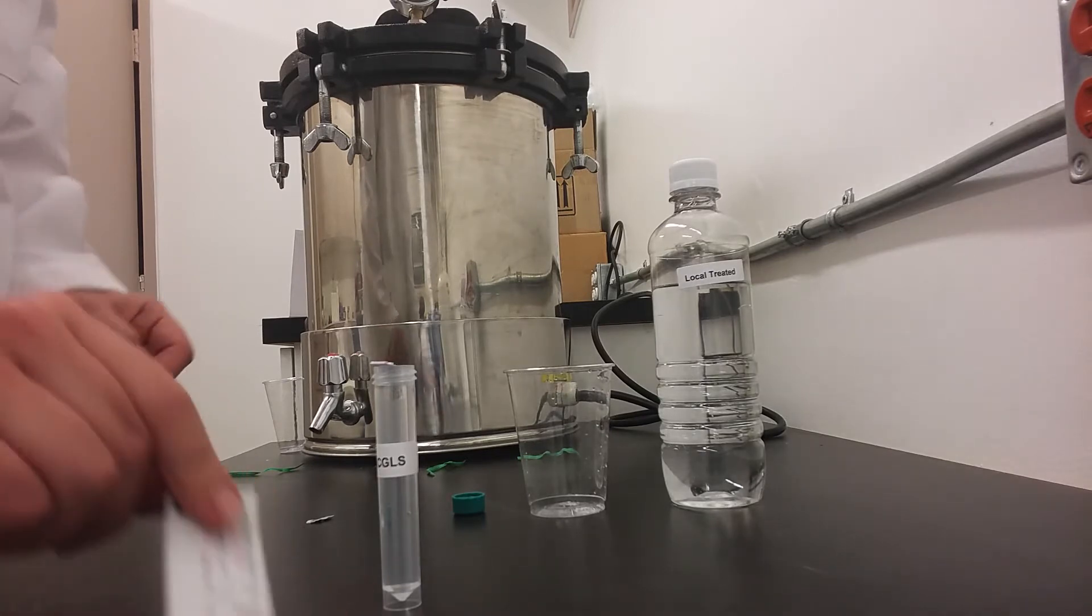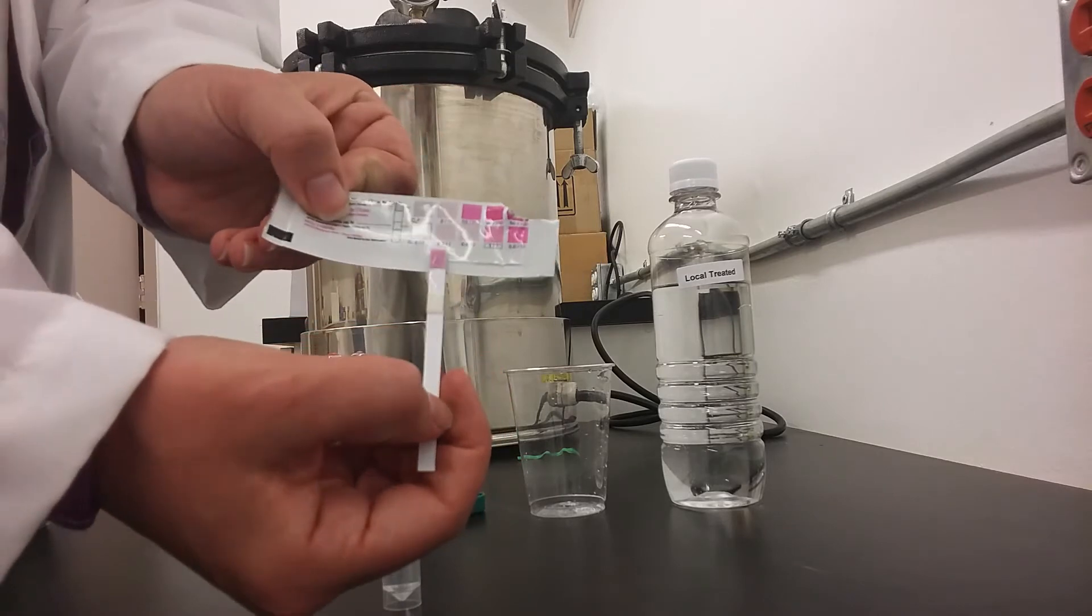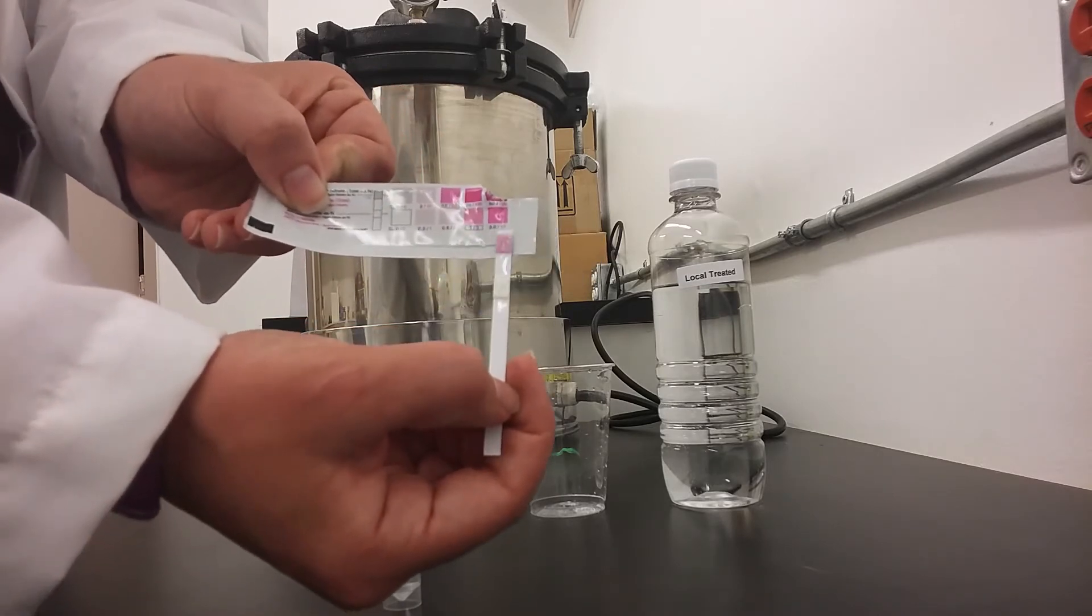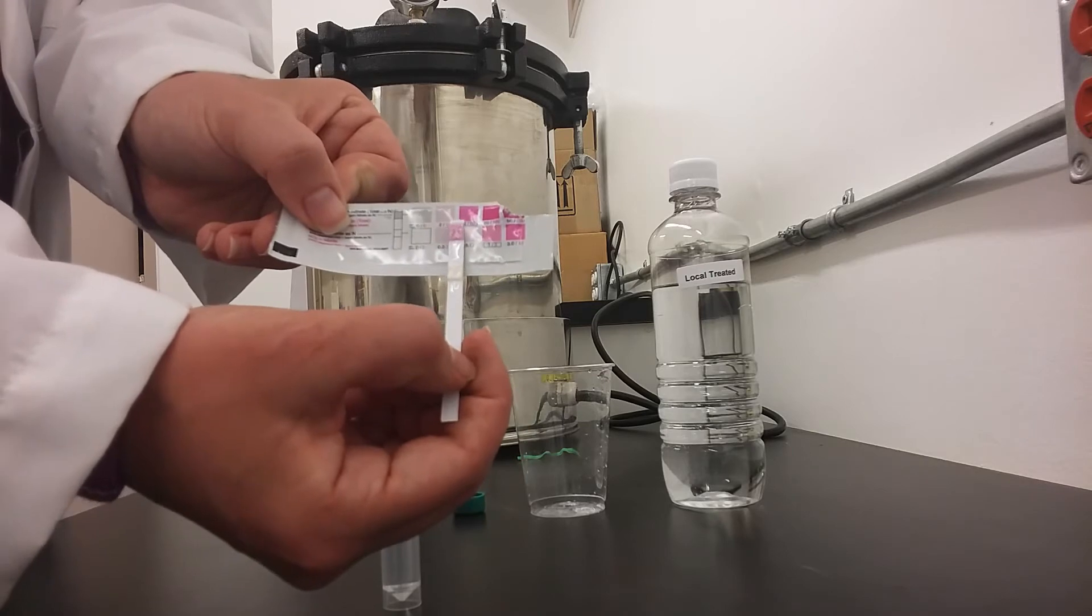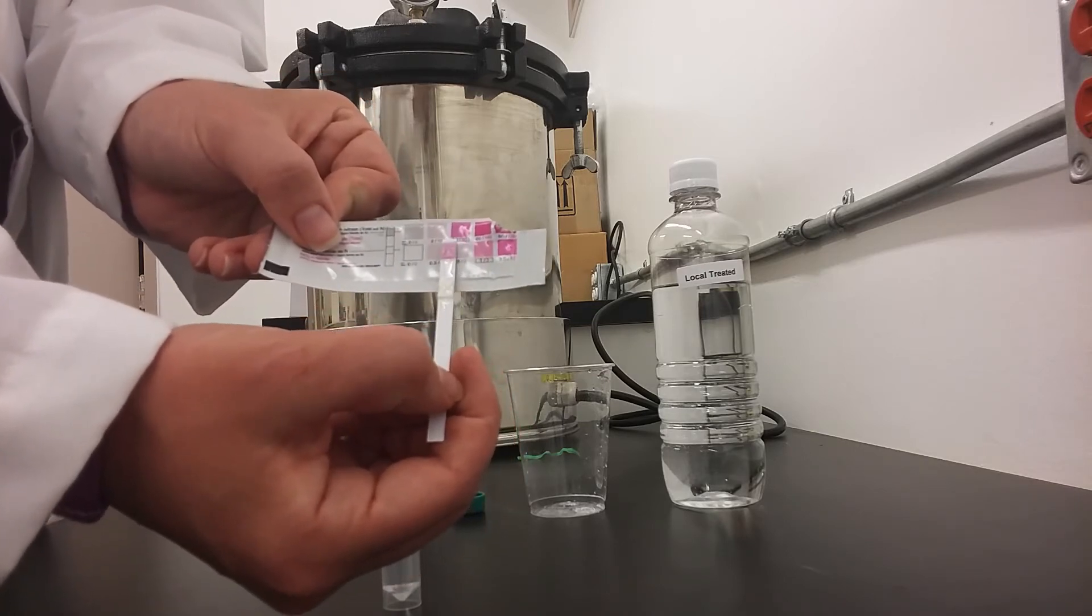Now that the sample has cured for one minute, you will compare the test strip to the indicator on the back of the test strip package. If it does not match up exactly with any of the strips, feel free to write down the closest number or a number in between two close numbers.